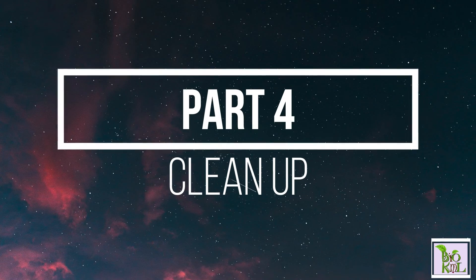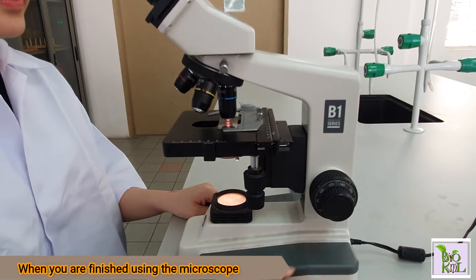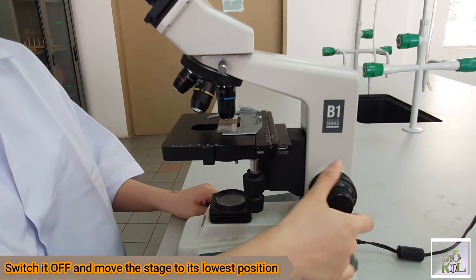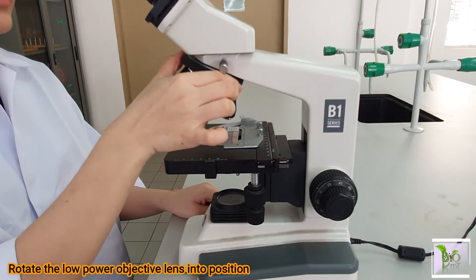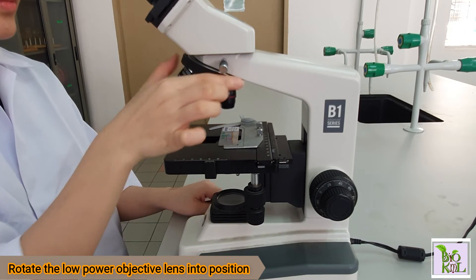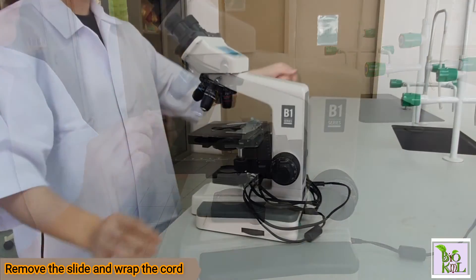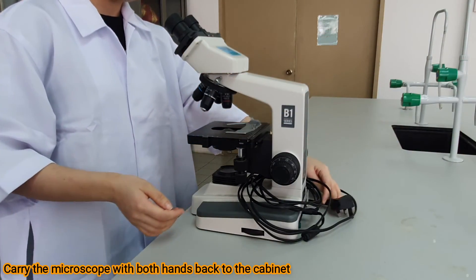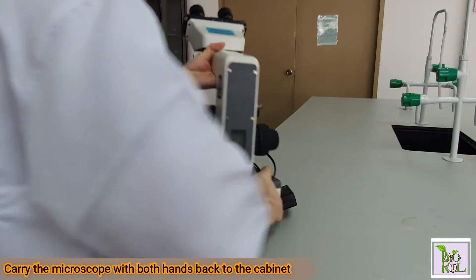Part 4: Clean Up. When you are finished using the microscope, switch it off and move the stage to its lowest position. Rotate the low-power objective lens into position. Remove the slide and wrap the cord. Carry the microscope with both hands back to the cabinet.